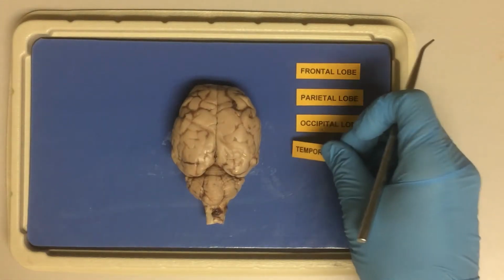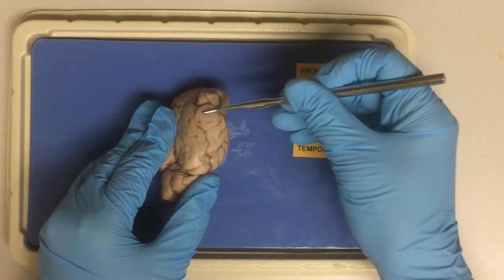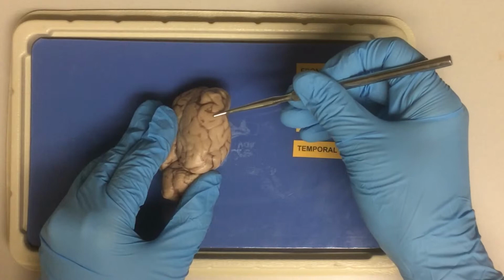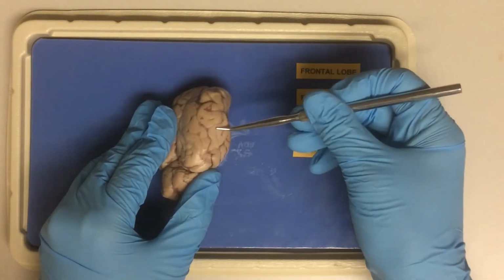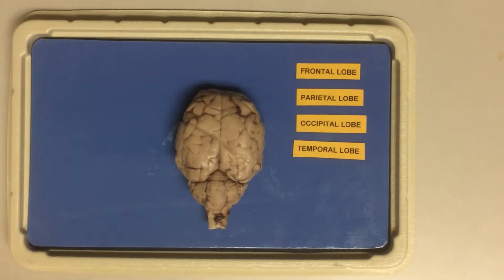And finally, I want to show the temporal lobe on the lateral parts of the brain. This is where the information from the ears is being processed, for example, comprehension of the sounds. In humans, this is where we would have the language processing, both for hearing and speaking. And although this is not as big of a deal in sheep, it is somewhat important, so this lobe is there.